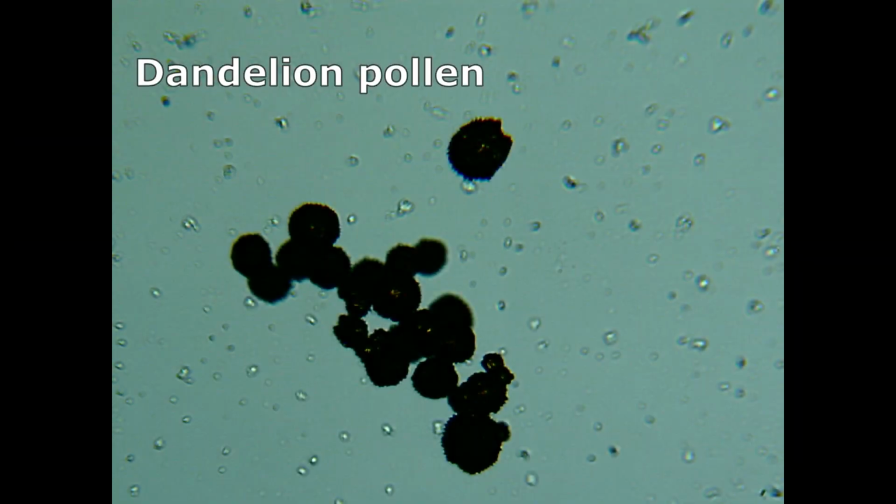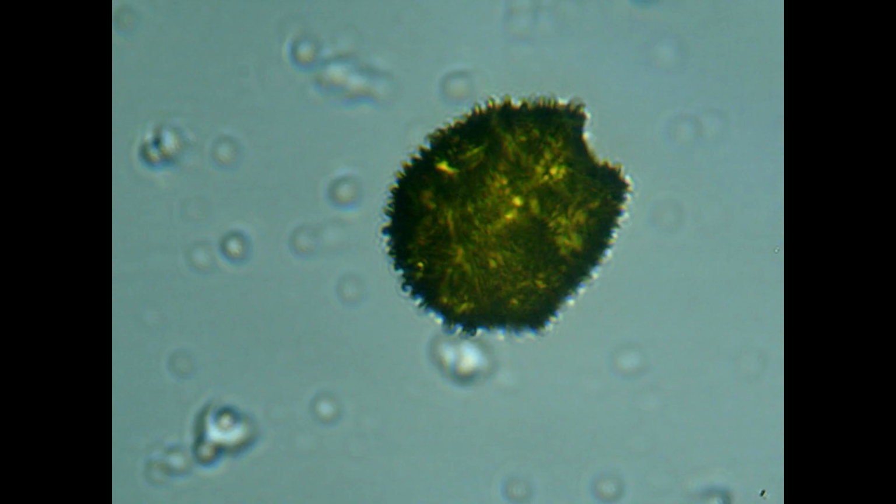Here's the dandelion pollen. There's a clump of it there, and then there's one single grain of it just above it. Do you notice something about its texture? Here's a closer look. There are little hooks all over this thing. What could those be for?